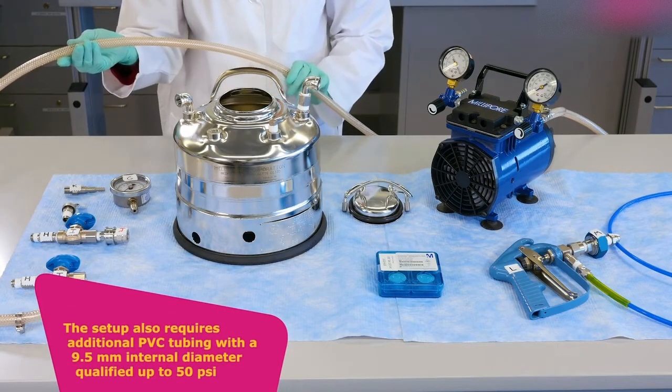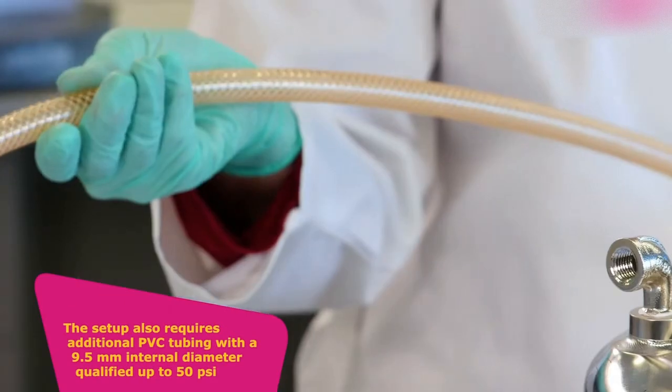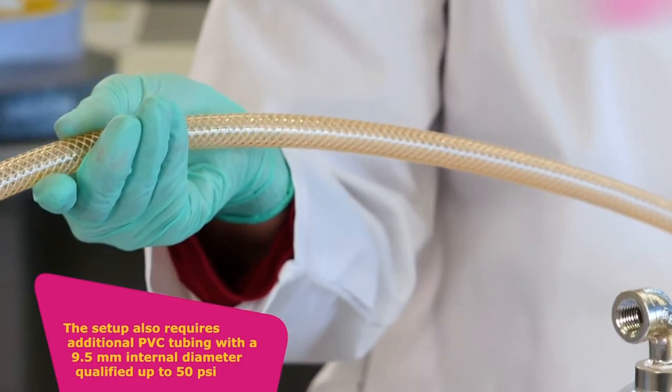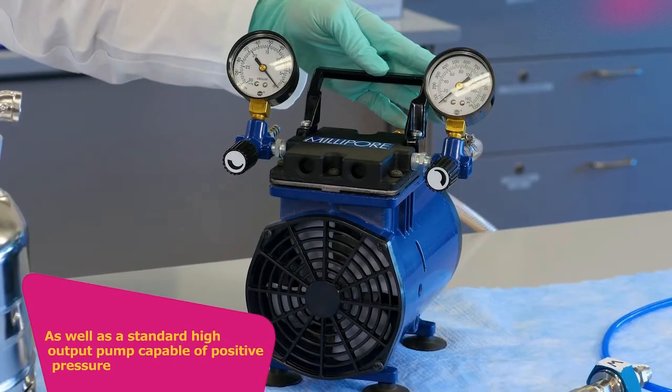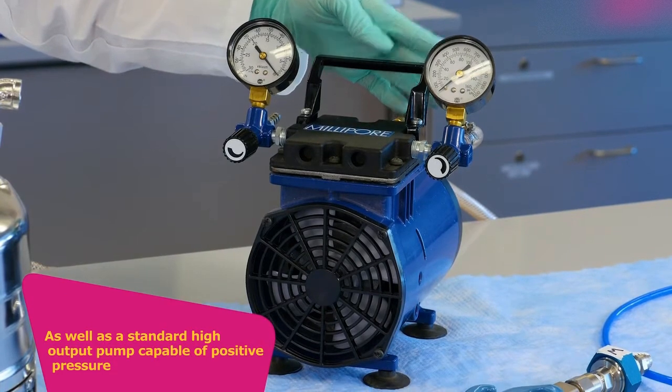The setup also requires additional PVC tubing with a 9.5 mm internal diameter, qualified up to 50 psi, as well as a standard high output pump capable of positive pressure.